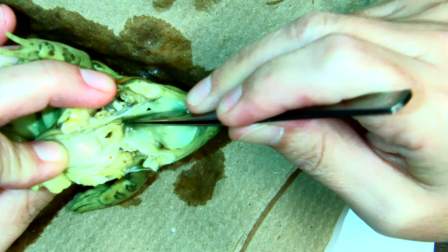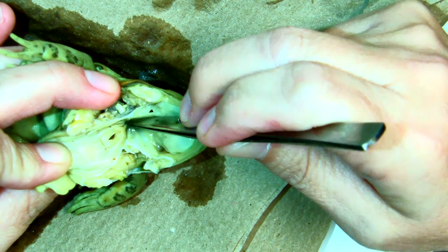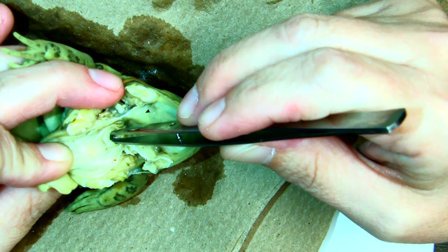The gullet goes to the stomach, and that's where the food goes. The glottis goes to the lungs.